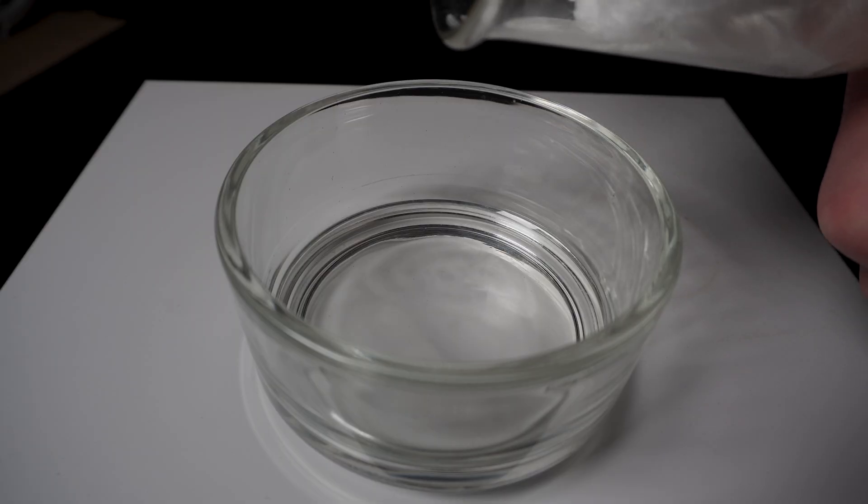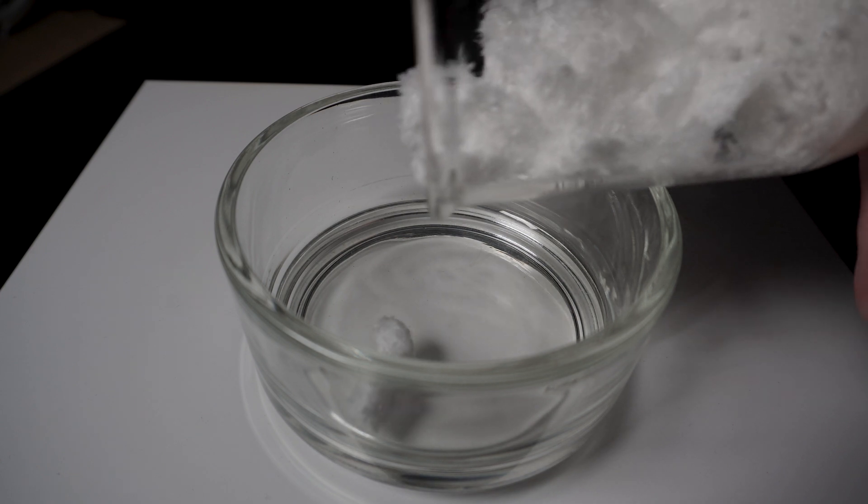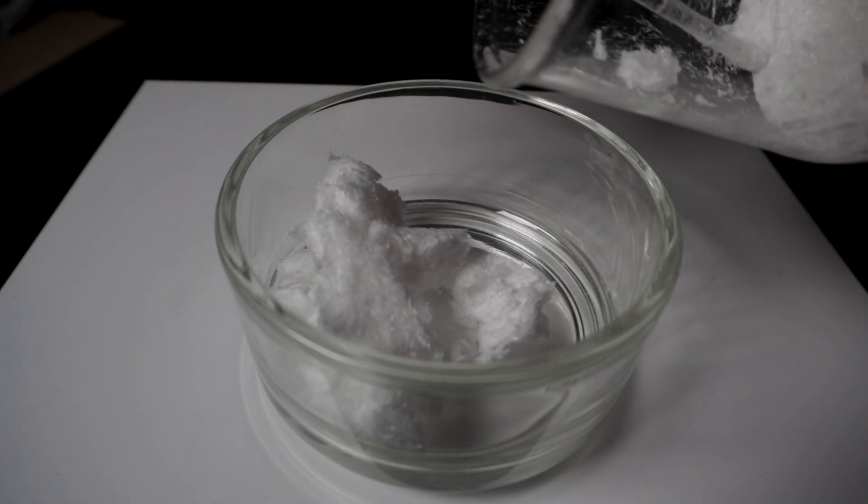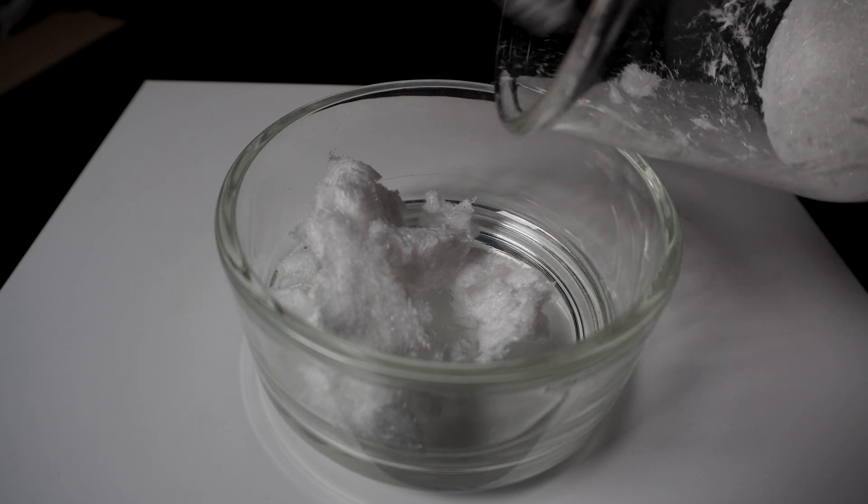My final yield was pretty close to what I was expecting with 15 grams of pretty pure salicylic acid. In the method written by UC-235 they said the expected yield was about 95 percent.